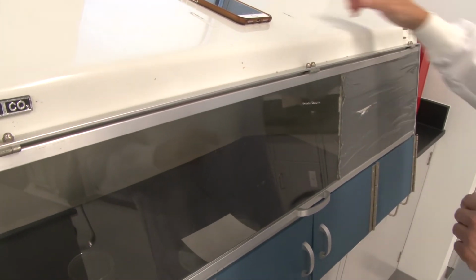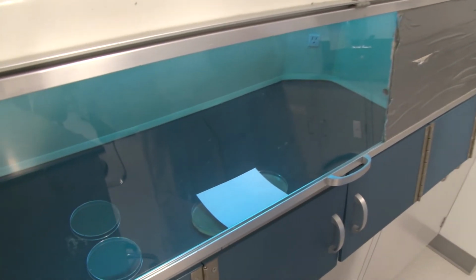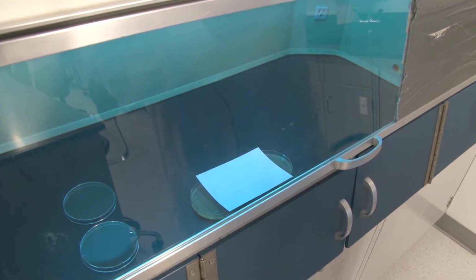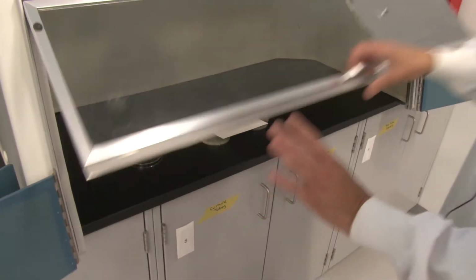Watch, I'm going to turn on the light, start the timer. I'm going to watch the timer. When 10 seconds is up, I'm going to shut off the light. So I'm watching the timer, 8, 9, 10. Okay, we open this back up.